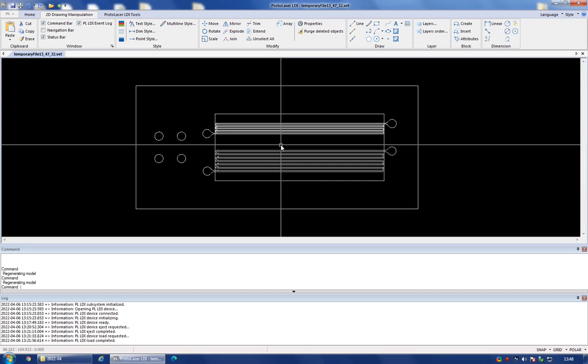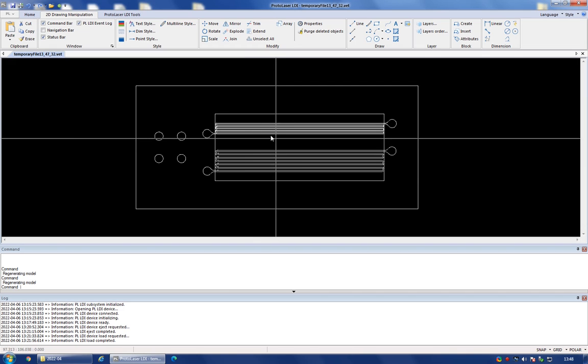So when I prepared my drawing, I prepared it in millimeters. So if a line was, say, 30 millimeters long, I would have input 30 to mark the length of it. So if I were to draw this same line in this software, I'll have to input 30,000. So the first thing I need to do is to scale the drawing.